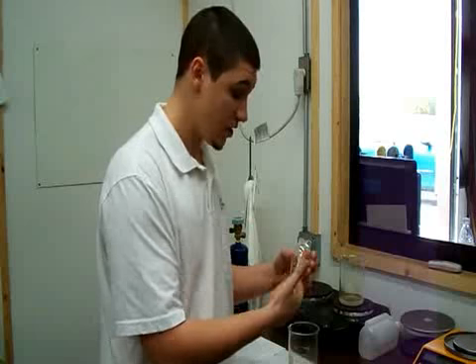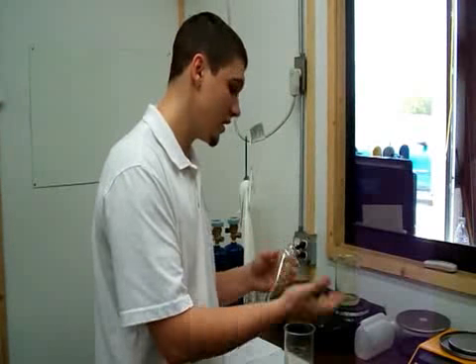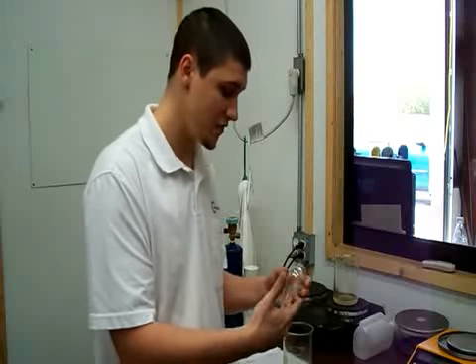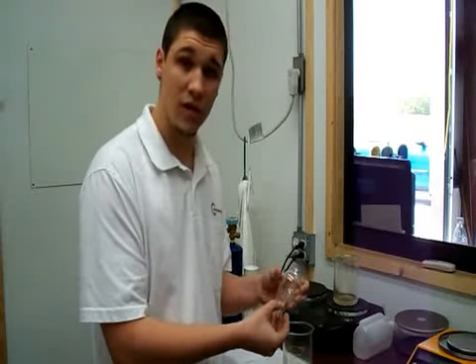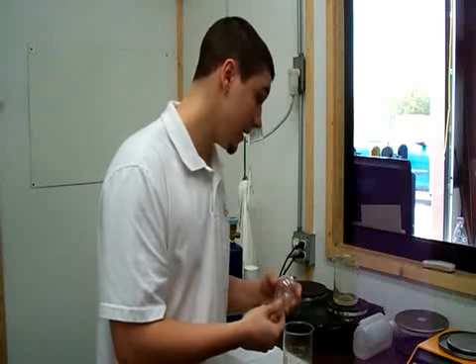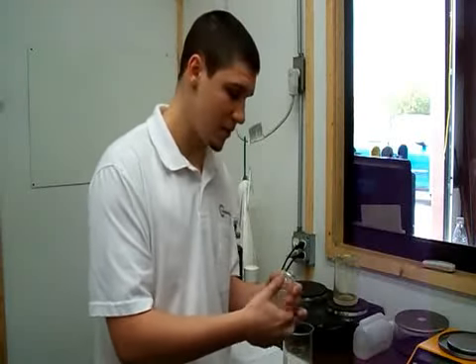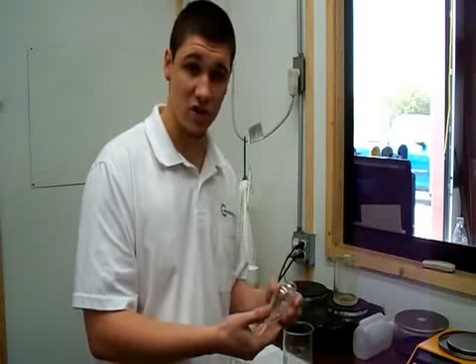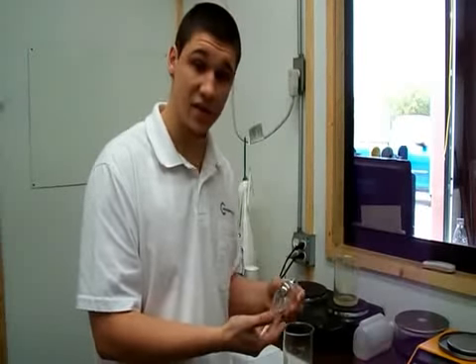gas that we are testing, or they can send us in a full oil sample that we will boil off and also tell the percentage of oil in the chiller that they send in. Either in an oil sample, or as I said, for our cert, we'll be able to get an oil number that we have a standard for, that we can check in our records, and if it is under the standard, we can pass that through and send this off to what we call InterTeck.